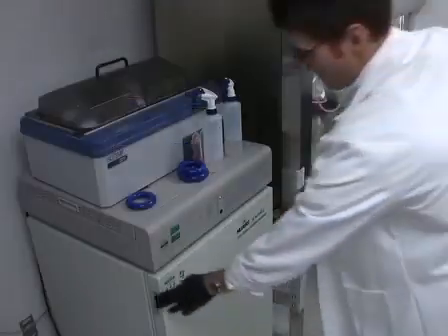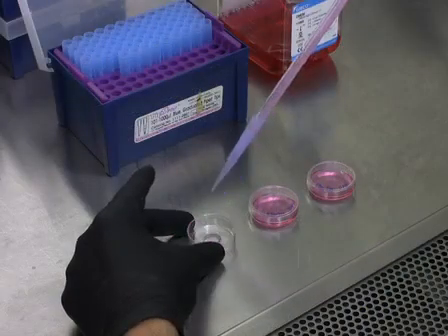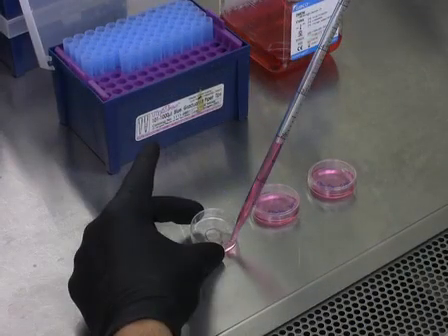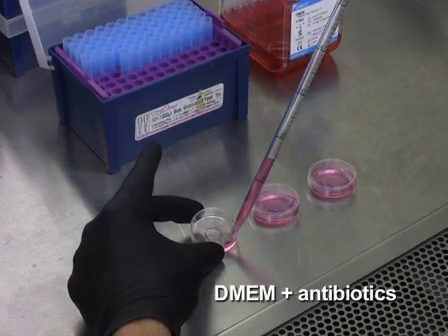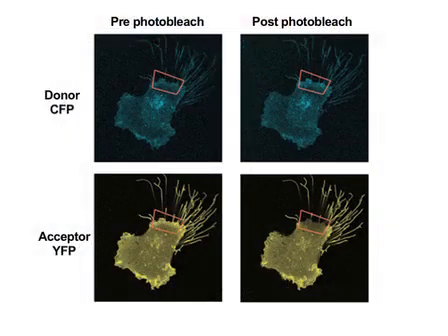After 24 hours, carefully aspirate the medium from the cells and pipette fresh complete DMEM with antibiotics. Following transfection, cell viability should remain relatively high. Few to no floating cells should be observed.